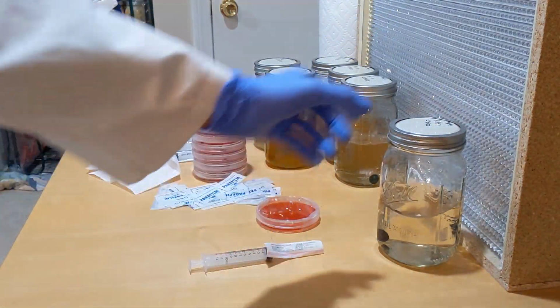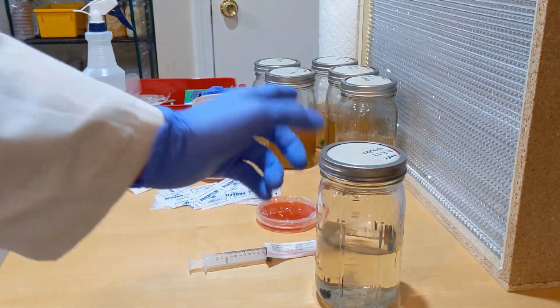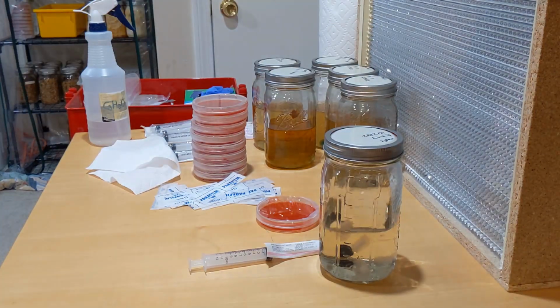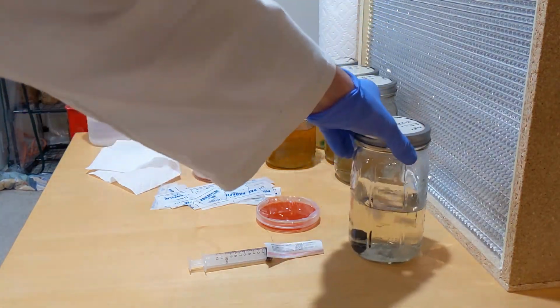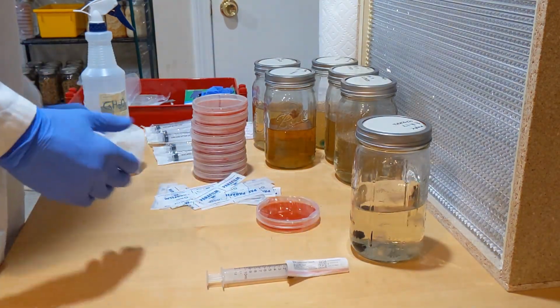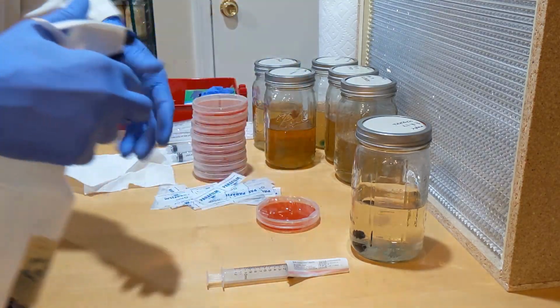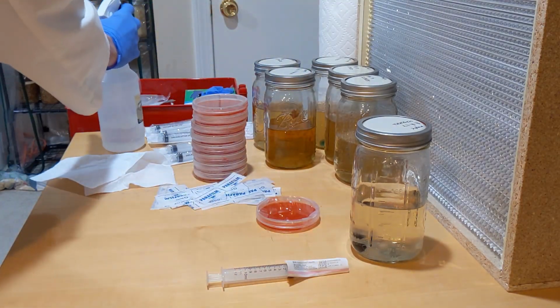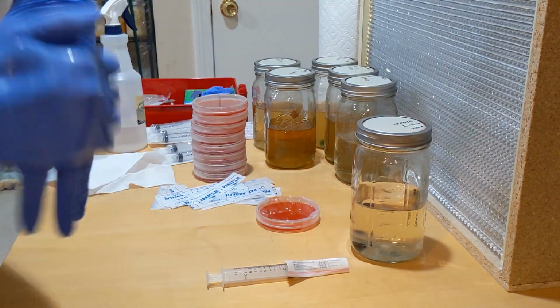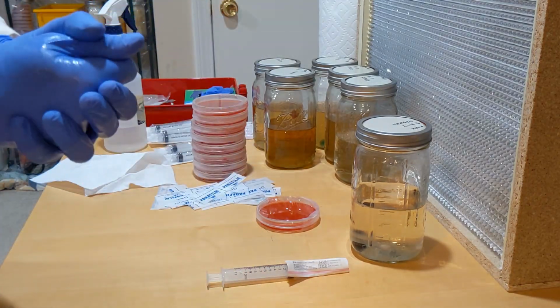So same concept. If you want to be cleaner, you can always make those injection ports for the lids. I'm a little lazy at the moment, and this baby is awesome, so I just don't bother with it too much. But I don't know, if you work cleanly, you should be fine as well, even in a still air box. If you're doing a lot of jars, it's kind of a hassle to modify all those jars. So this ended up saving me a little bit of time, and it was kind of worth it.